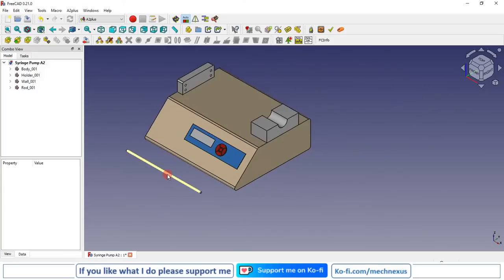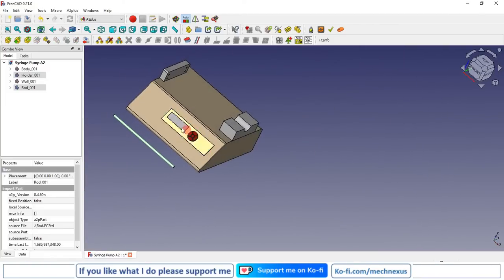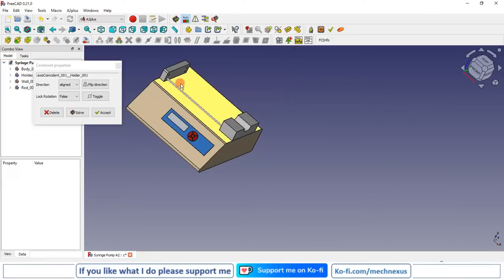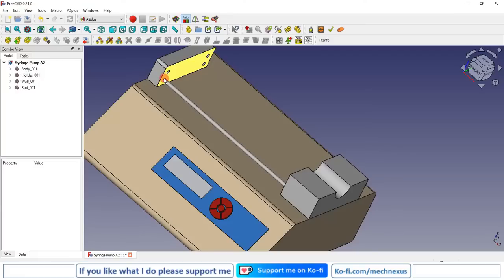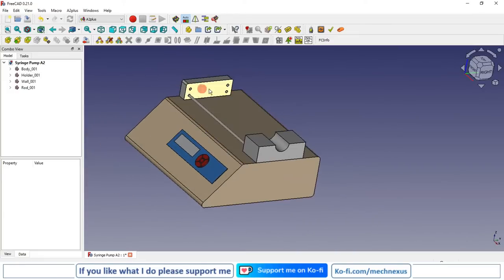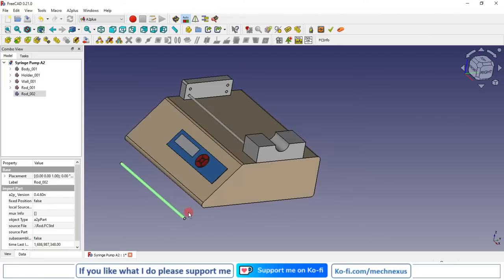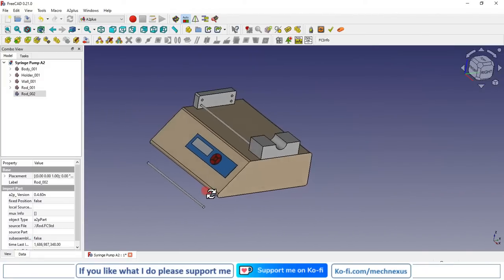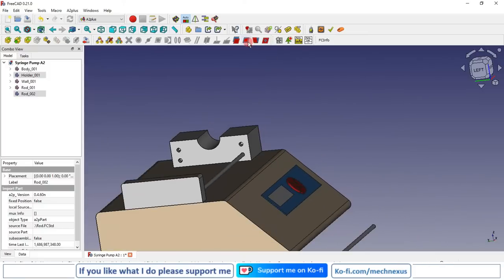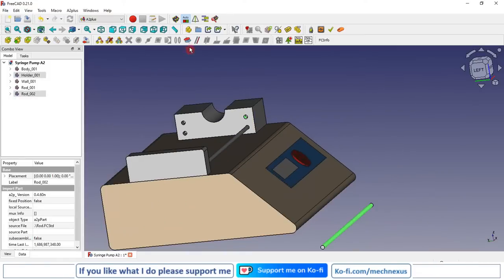Now I will select the surface of my rod and surface of the hole, and here FreeCAD is suggesting it is a axis constraint, so I will select it. So you can see that rod has been perfectly placed from this body to this body. Similar way we will assemble other 3 rod. So go to the rod, insert it and do the same process. Click on coincidence constraint, accept, select on the surface, select on the hole surface and give axial constraint.